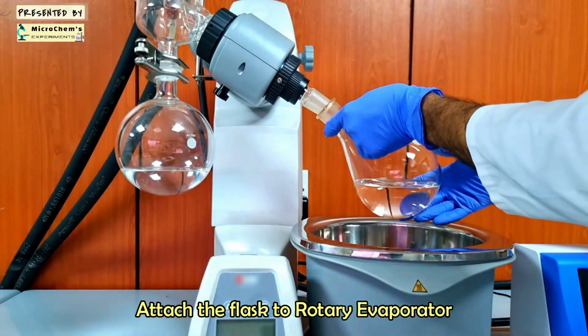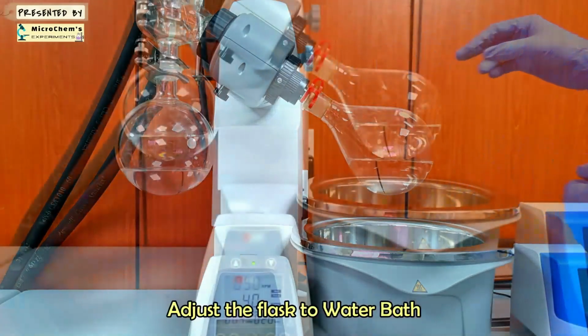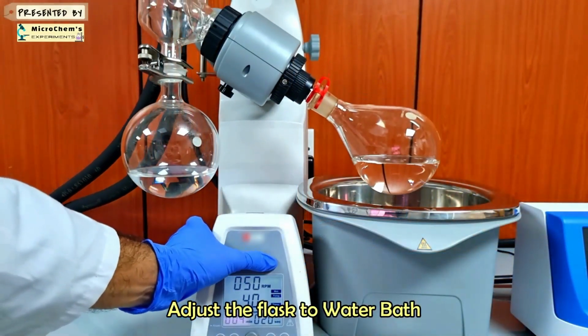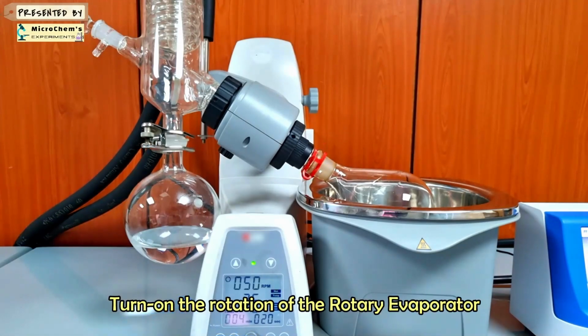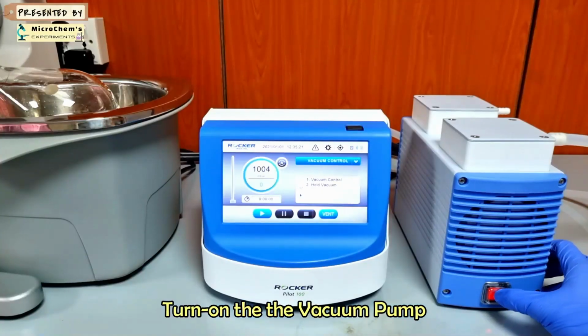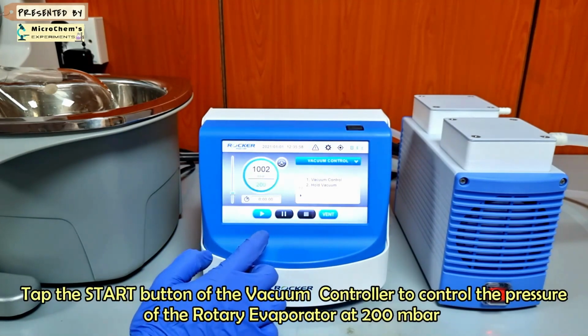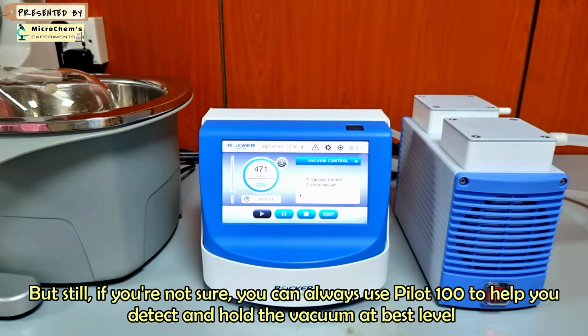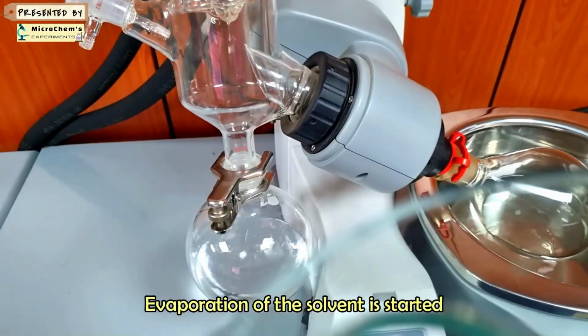Attach the flask to the rotary evaporator. Turn on the rotary evaporator unit. Turn on the pump. Set the pressure at proper point. In this case, 200 millibar is enough. But still, if you are not sure, you can always use Pilot 100 to help you detect and hold the vacuum at best level. Evaporation is started.